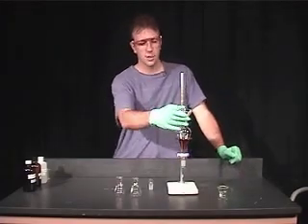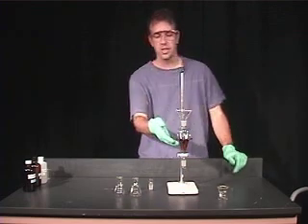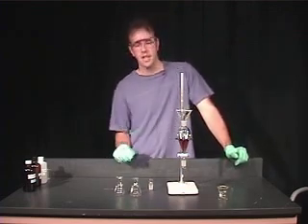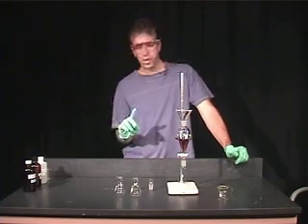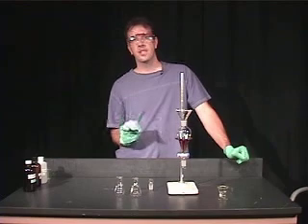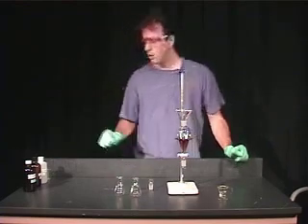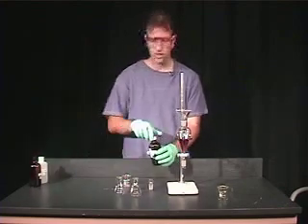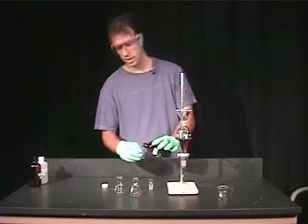So at this point, we want to add our solvent. This is an aqueous solution, and I'm going to extract this caffeine using two different organic solvents. The first one is ethyl acetate, and the density of ethyl acetate is lower than water, so it will remain on the top of our aqueous solution.